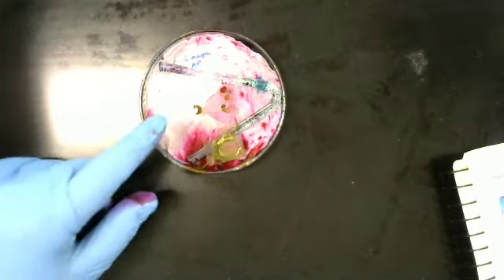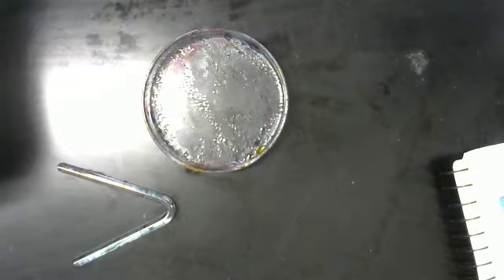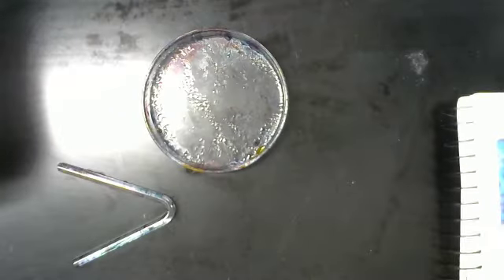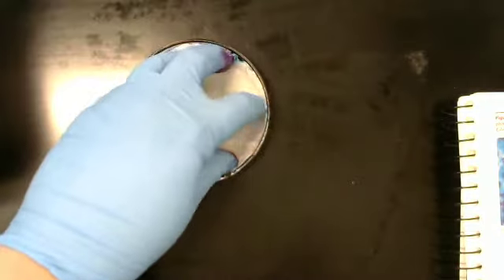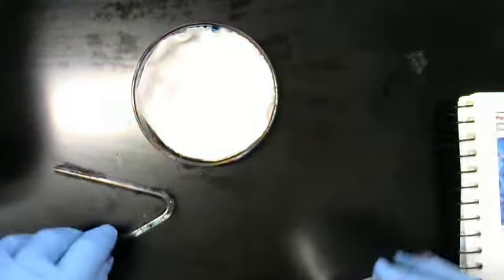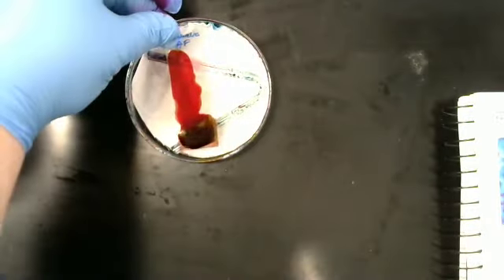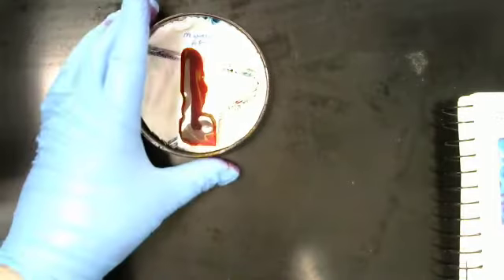So we're just going to set this off over to the side. Now let's do the prep again, but for our other slide. This is for the Mycobacterium. We're going to take some paper towel, line the bottom, give it some DI water, put our V-rod in, and we're going to bring over our Mycobacterium slide, put it right there, and we're going to go put it in the microwave for 30 seconds.